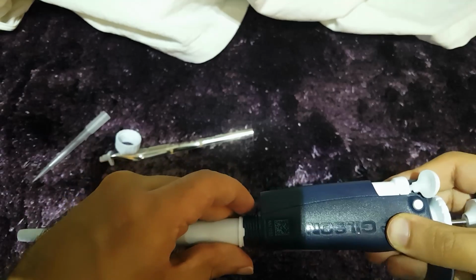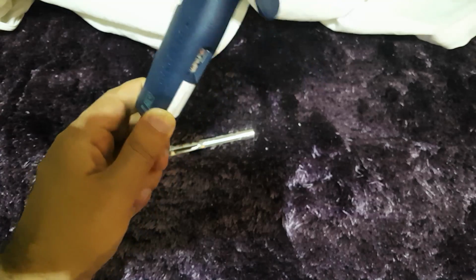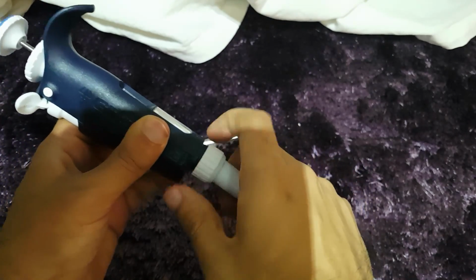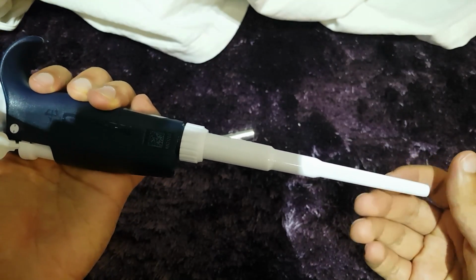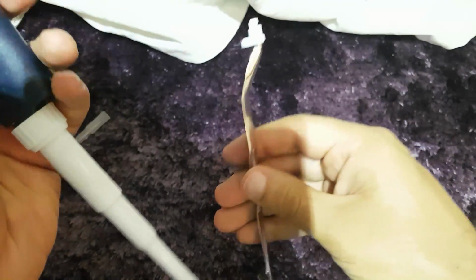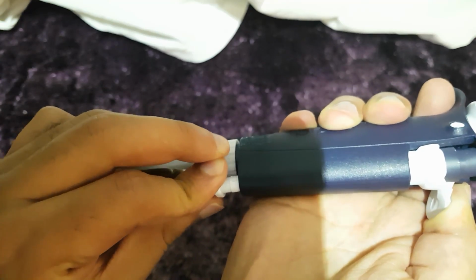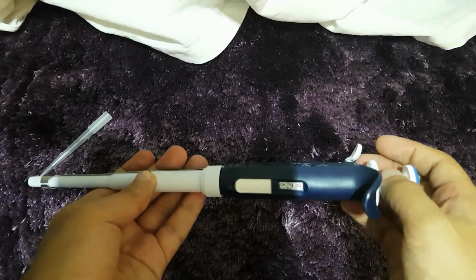Okay, and now what you have to do is you take this here and you simply screw it back into place and make sure it's screwed nice and tight. As you can see, it's screwed up nice and tight there. Next step, we take the ejector arm. As you can see, the ejector arm has something there. You simply push that through here. Again, you simply just slot it into place and wait for the click. Now, there we go. We have our pipette back together again.